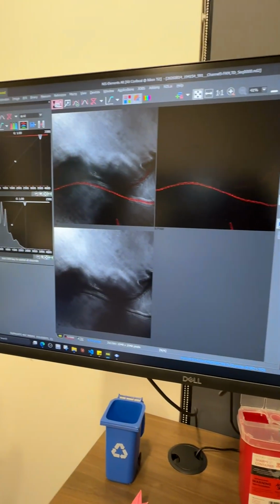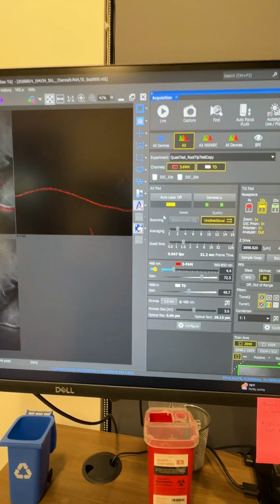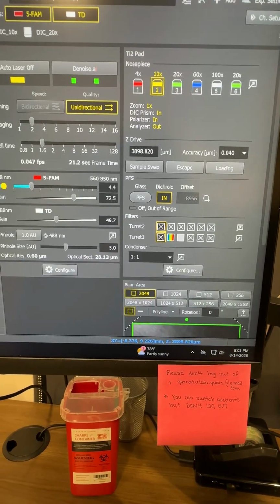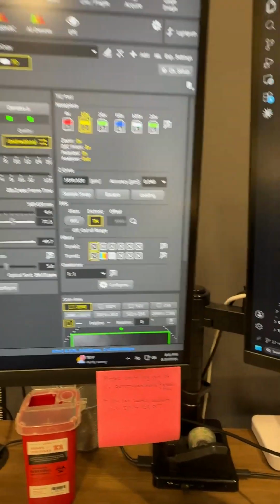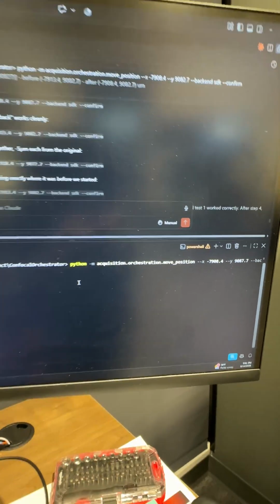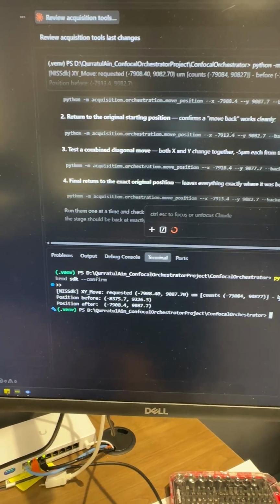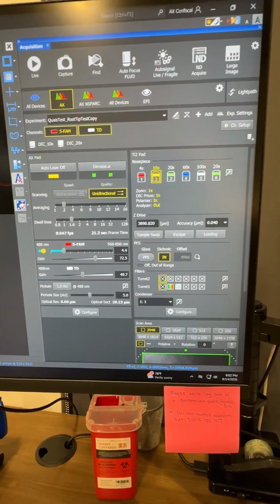So this is happening through the NIS, but right now I have tried using my script, and will show you how it works. Let's do it through my script. So right now the XY position is -8 something and 9 something for the Y axis. I'm using this command where I'm moving the positions with X as 7908 and this. Let's run it. As soon as I ran it, if you see, the position before was 8375 and 7908, and you can see in the UI also it changed.